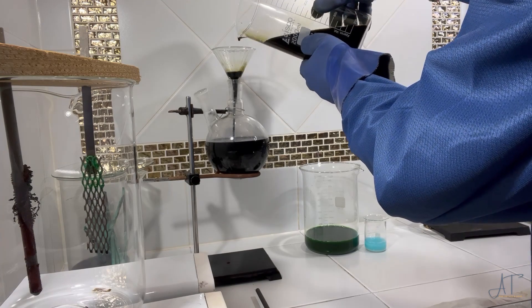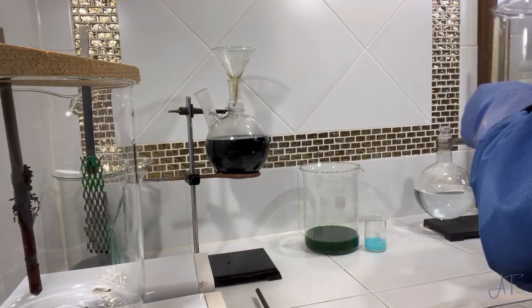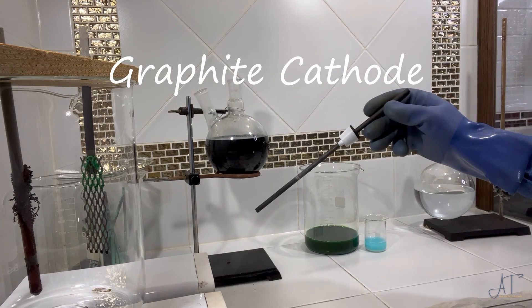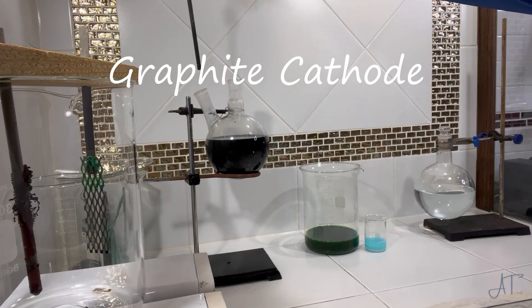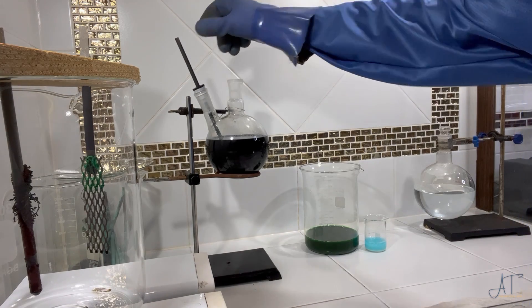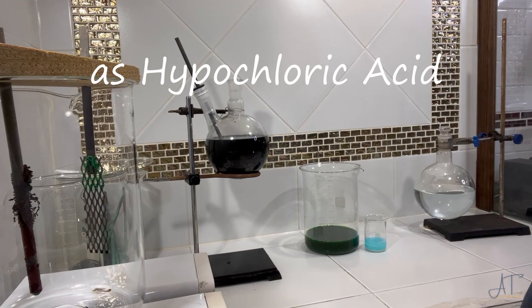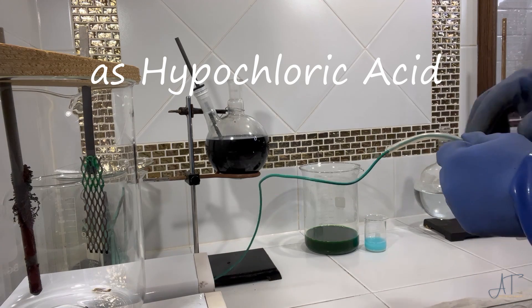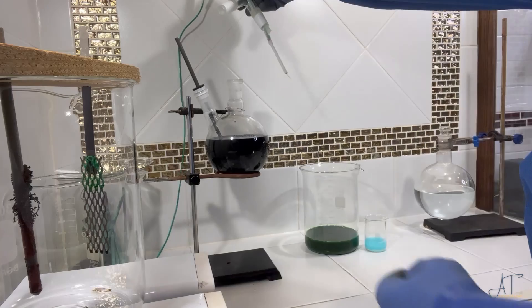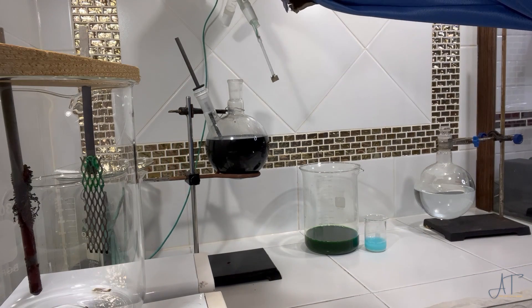Here I want to show you how, by using electrical current inside the aqua regia in a controlled distillation setup, our hydrochloric acid will distill over and can be reused. Also, with this process, chlorine gas is generated at the anode and hydrogen gas will be generated at the cathode.